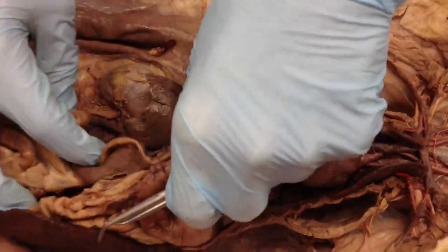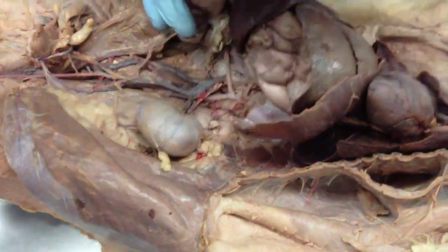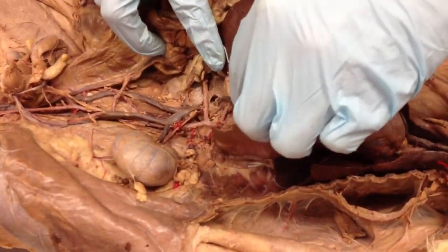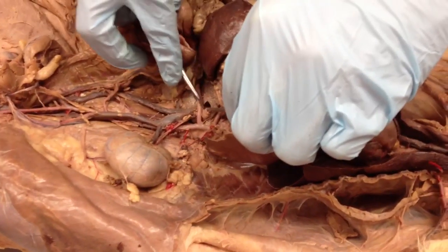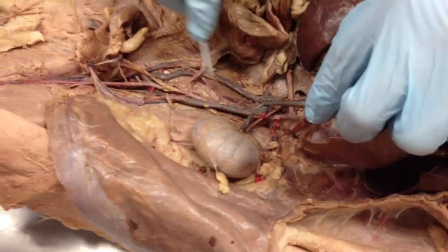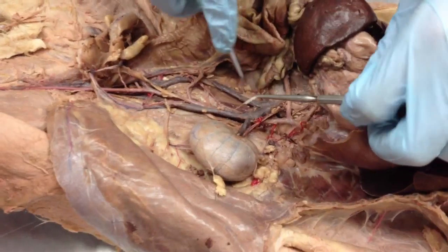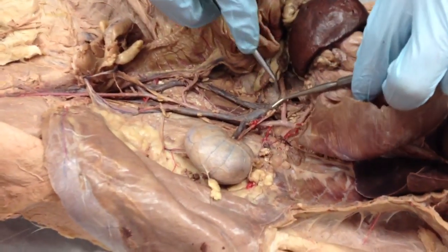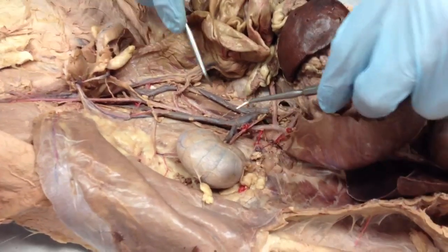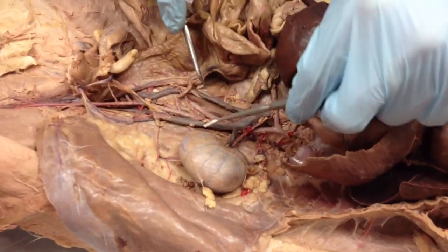Continues running down there. So this is where it gets weird with this guy. You can't see it all that well, but it's under there. You can kind of see how that's your inferior vena cava. And see how it branches way up here? This shouldn't actually happen until down here, but this does happen occasionally. More commonly, you're just going to see an inferior vena cava running all the way down and branching right here. For some reason this guy branched way up here. So that's why you see this large vein here and that large vein there.